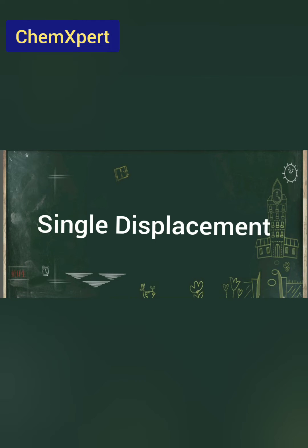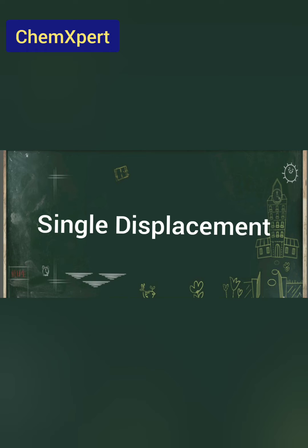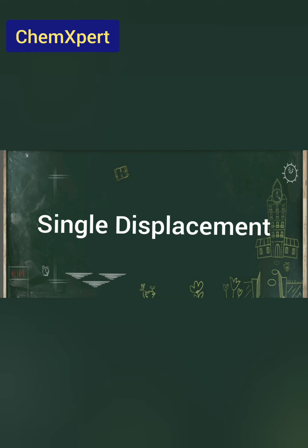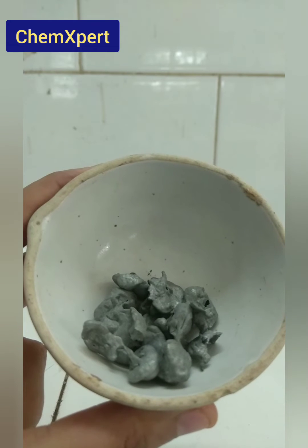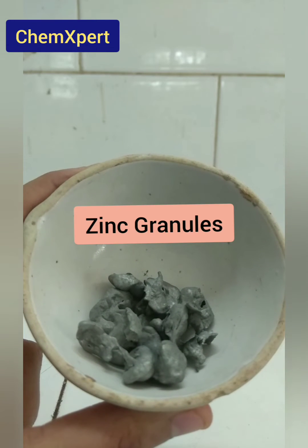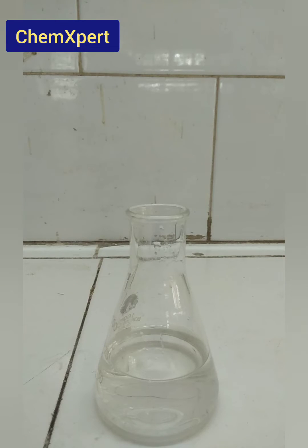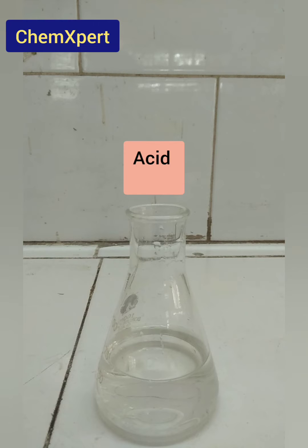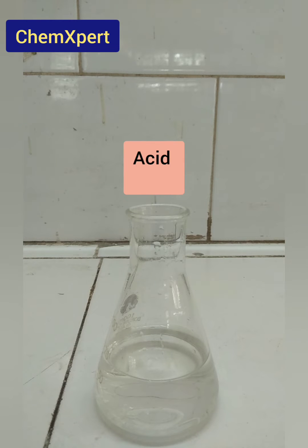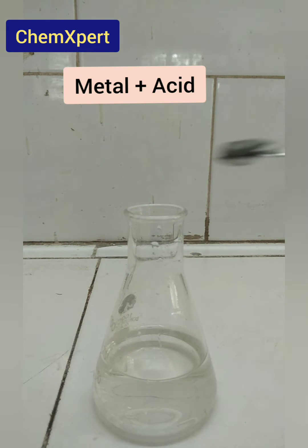Single displacement reaction is the reaction in which a more reactive element displaces the less reactive element. For this experiment, we required zinc granules. We have taken the zinc granules in a china dish, and then an acid in a conical flask. The next step is to add the zinc granules into the acid.